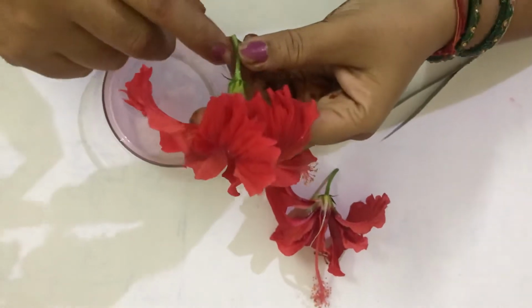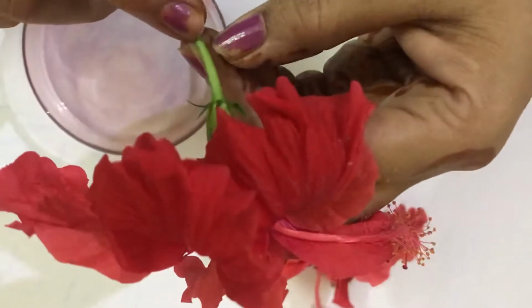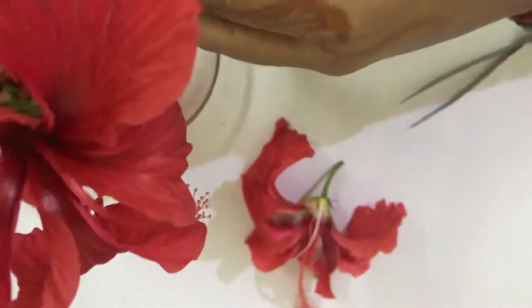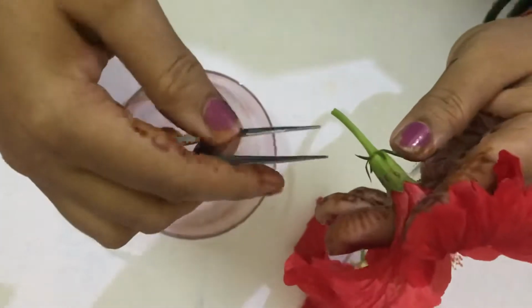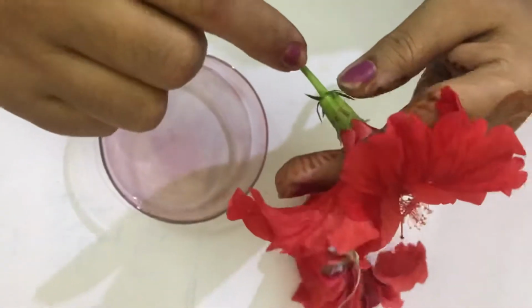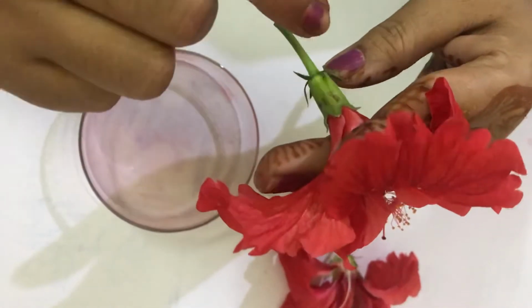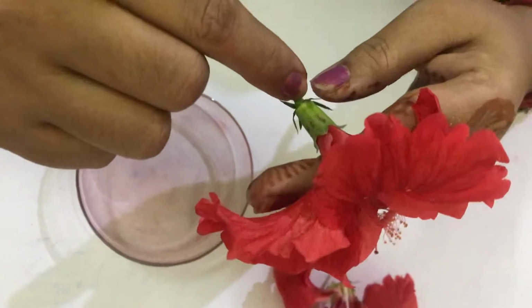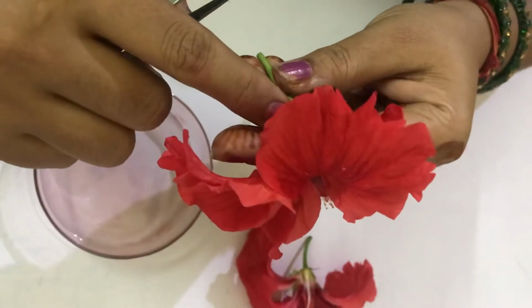About the description, let me explain. The flower is a terminal flower. At the end of the axis, a single flower is there, so the flower is terminal. It is borne on a small stalk, which is the pedicel, so it is a pedicellate flower. The bracts are not present, so it is the ebracteate condition.